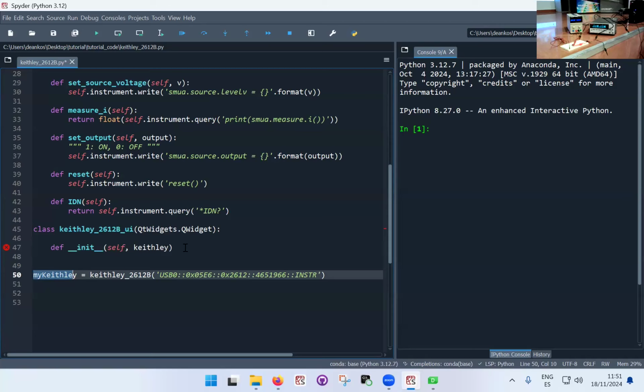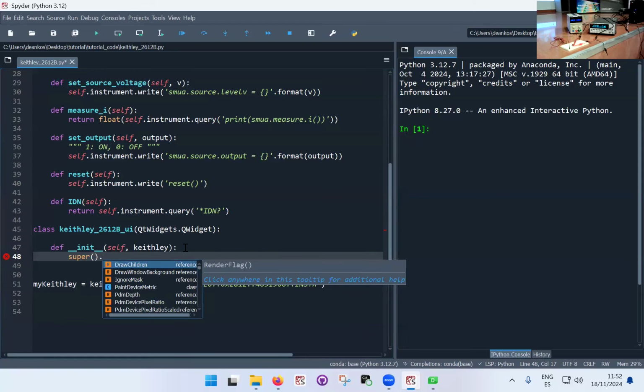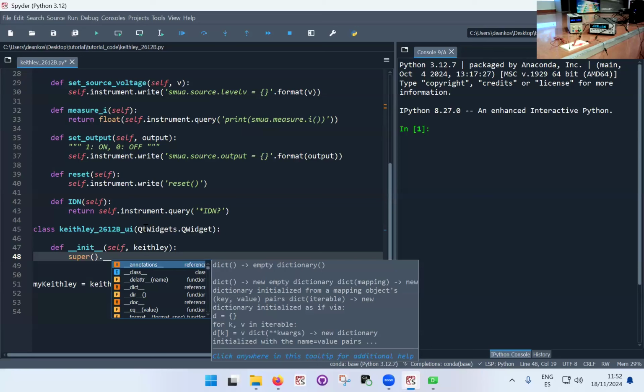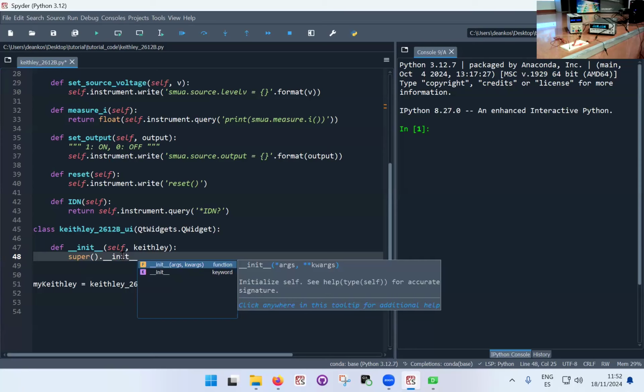Okay, it's going to be all a bit more clear in a minute once you actually generate the interface. So here's another bit of Python trickery. I'm just going to put the command in. If you do the same, just put the same. I'm not going to explain what it is right now. Basically, this is necessary when we are generating interfaces through these Qt widgets. We need to put this particular command in place because we're inheriting from another class.